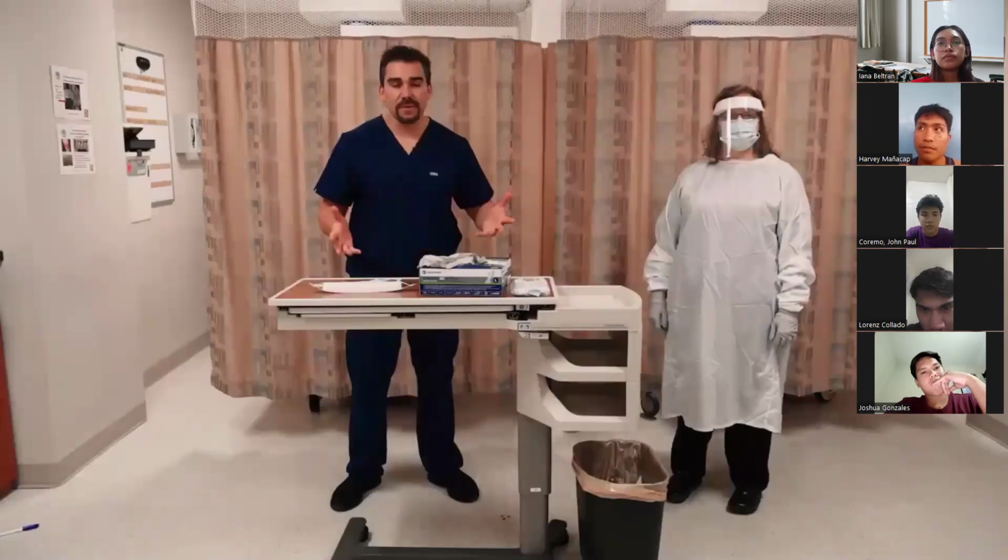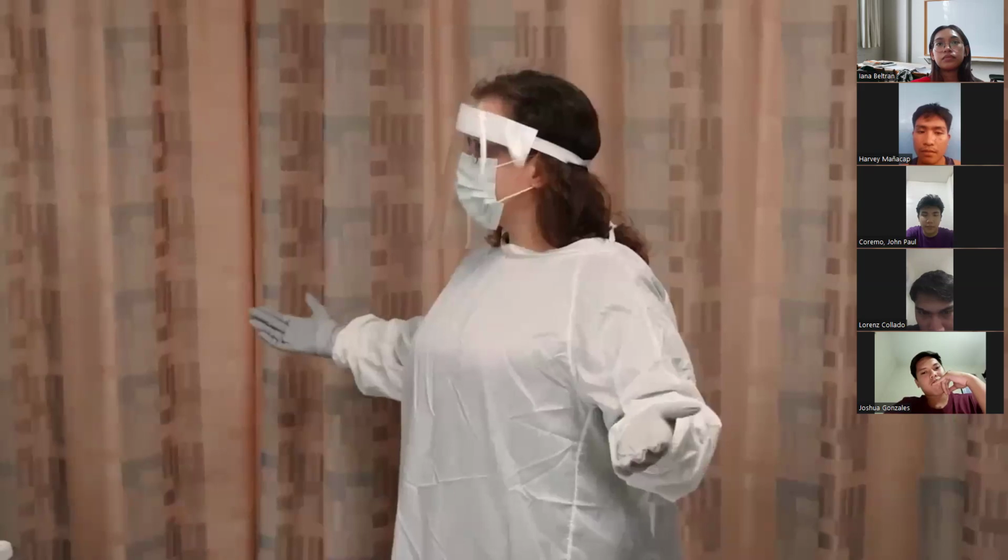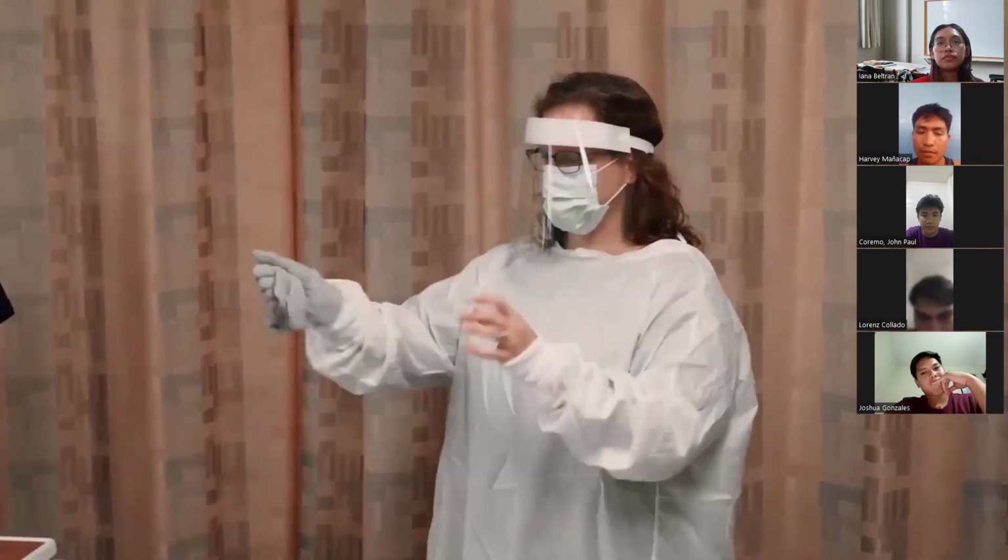Now it's time to doff, or basically take things off. So if we're looking at Kat, first things first, we're removing the gloves. So taking those gloves off.